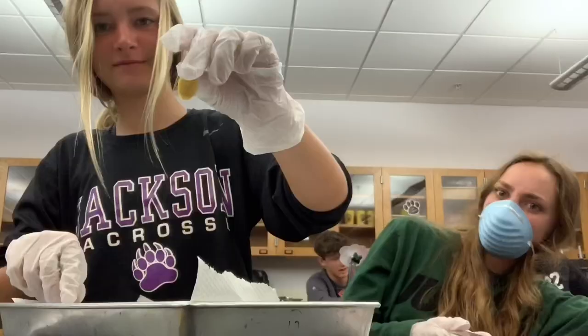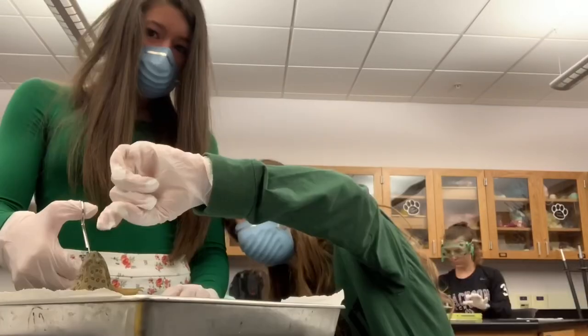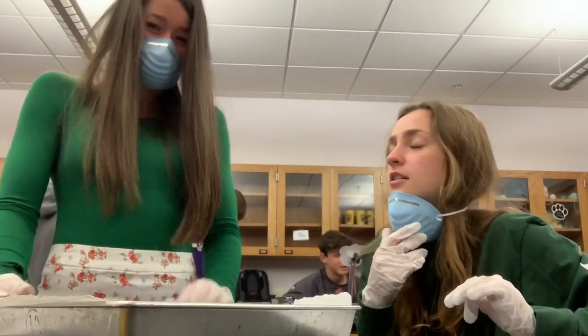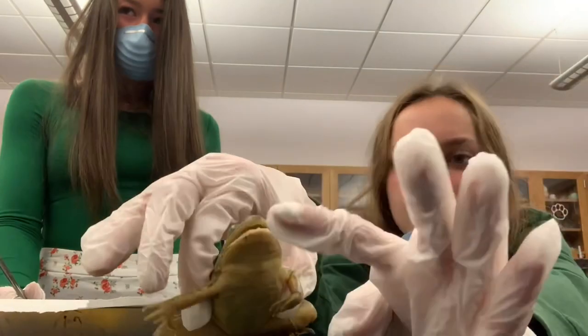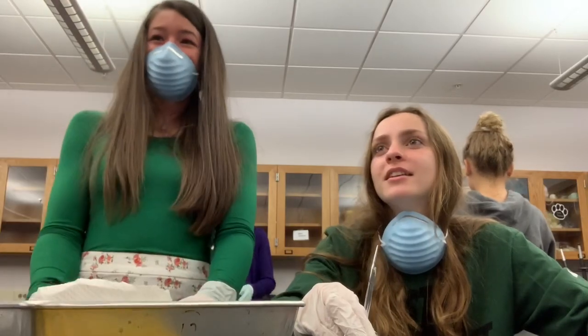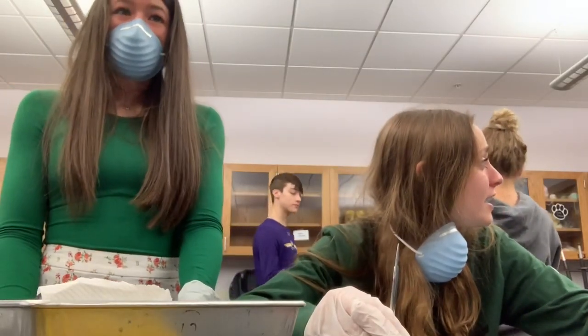If this squirts on me I'm going to be pretty mad — he's just having fun. I almost got it. Ew, ew! It has a nose! What do you mean — the whole frog? Yeah. All right, on the top — those are how frogs travel, right there. Here's the tea — okay, we have a different frog. They're just pregnant, I called it. She said it would be several — I told you. It's just that they have eggs.